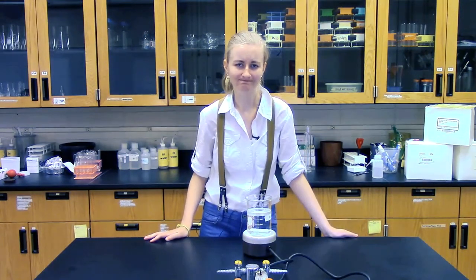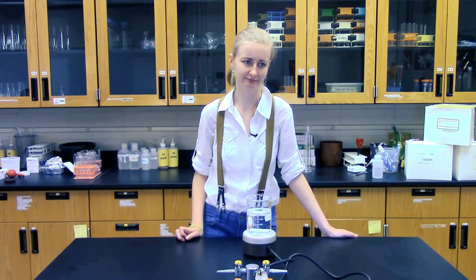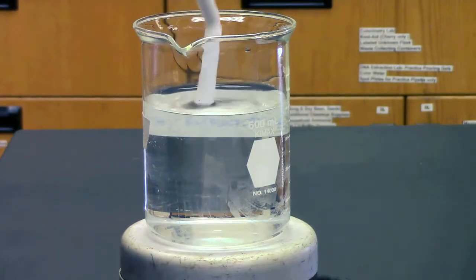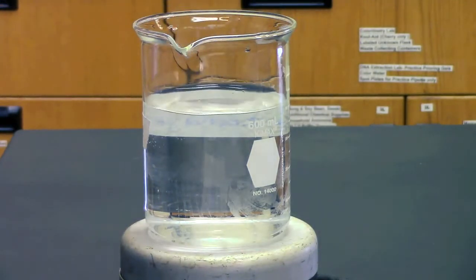But wait, how do you get this out without splashing yourself or making a mess? Well, there is this neat little tool that you can use that has a magnetic end to it that you can just stick into the liquid and the stir bar will stick to it.